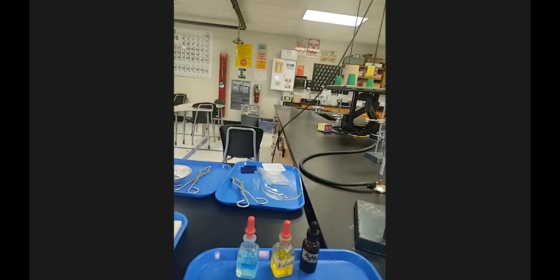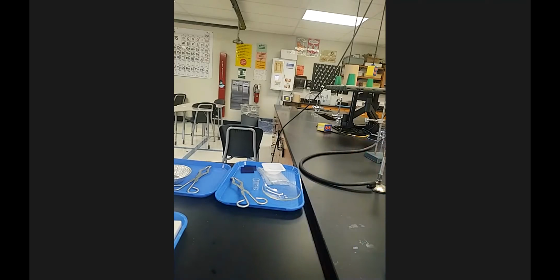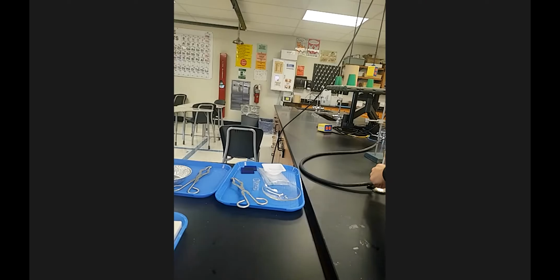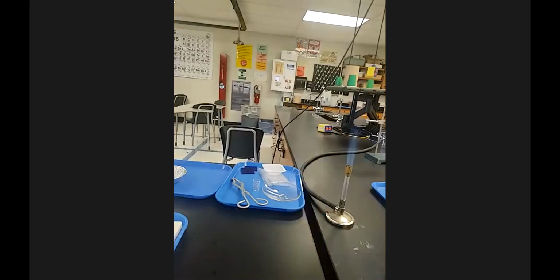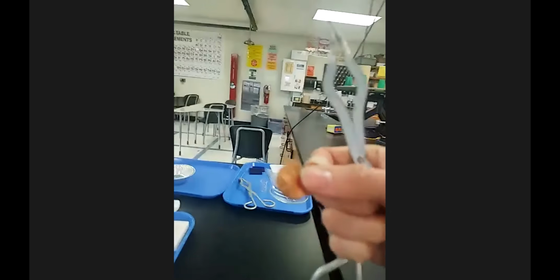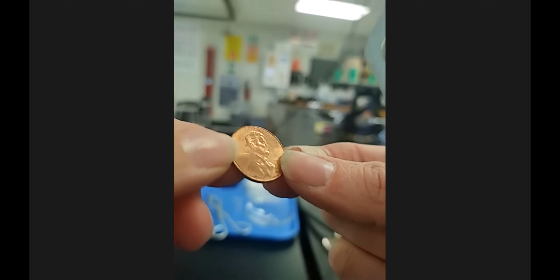Okay, so station 7 is our last one because you've seen station 8 the whole time. And so station 7 is, we're going to take a piece of copper. And in this case, we're going to use a good old penny. All right. Now, you might be like, Ms. Pruitt, a penny is not pure copper. You're right. But the outside is pure copper. And that's all we're going to be heating is the outside.